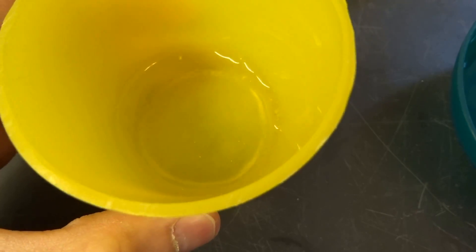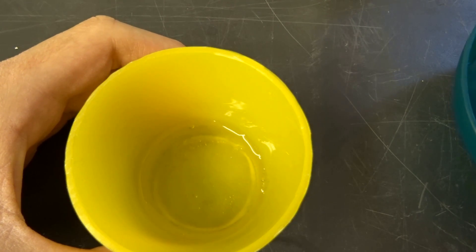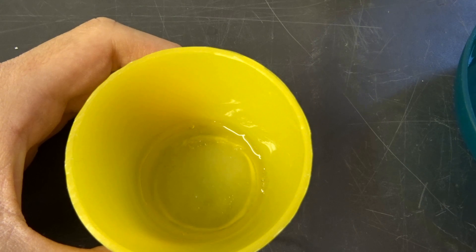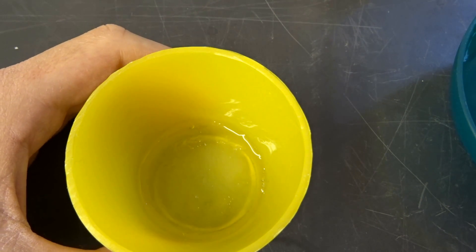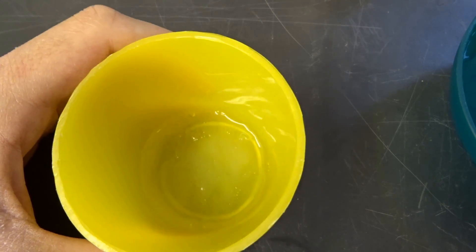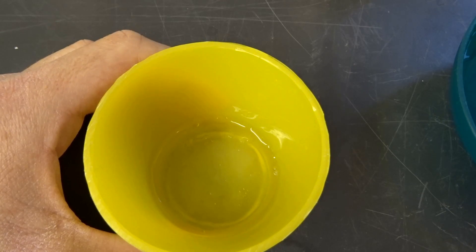They're more like glass that has some holes in it. So these didn't work out. So the green dish, the green preparation was the best one I could use for them. And now I'm going to wait a few minutes. Probably I did not wait long enough. I waited around 5 to 10 minutes.